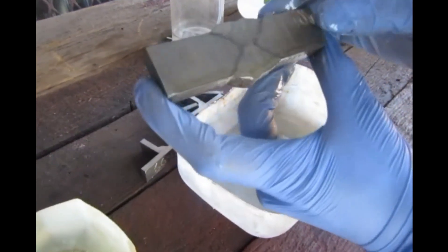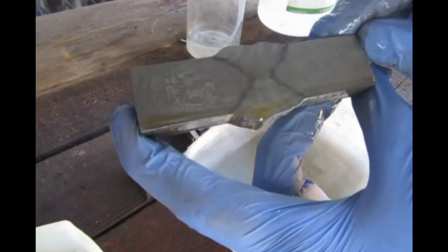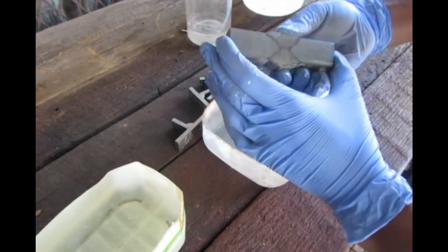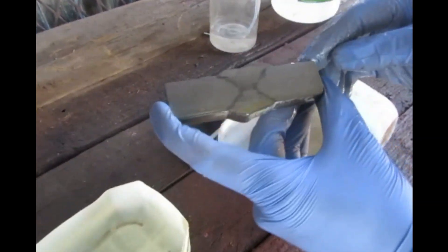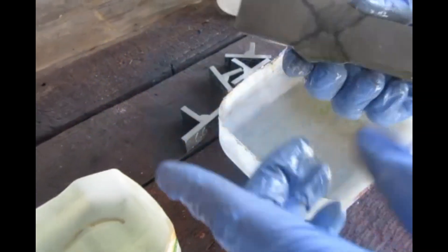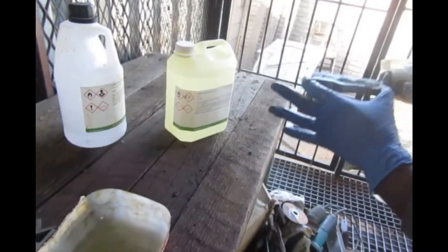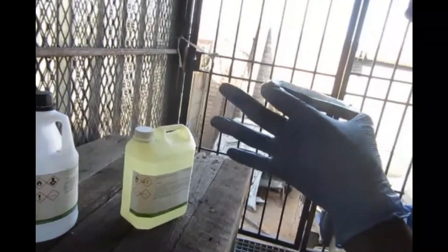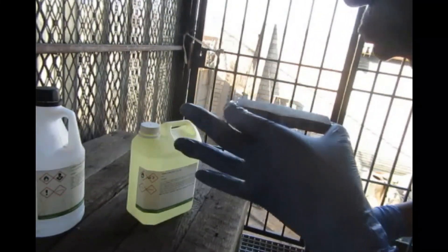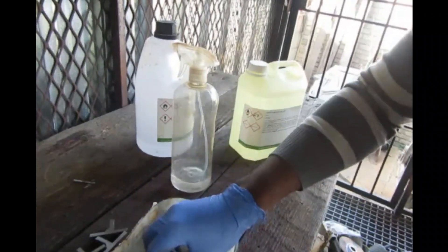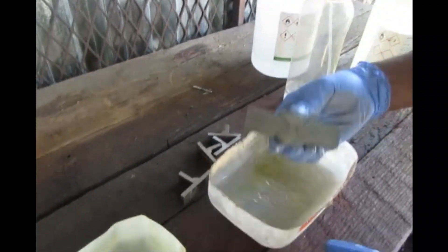This is so beautiful. Look at the runs, can you see the runs? The more time you spend it in the acid, the more it's revealing the runs. The water here is just to rinse it. I'm going to spray alcohol just to avoid the rusting of the macro.